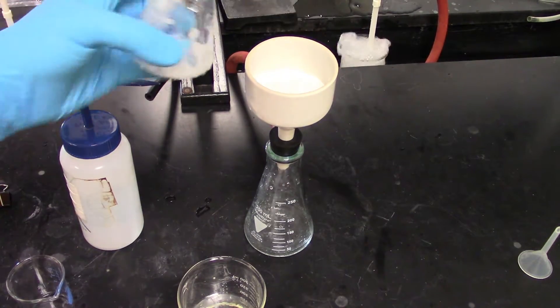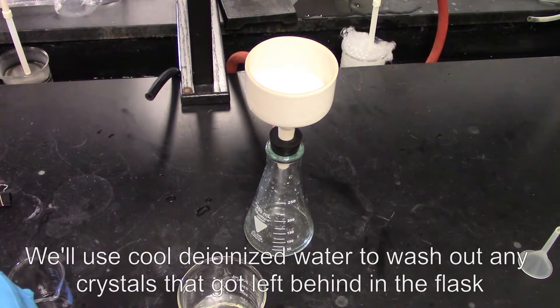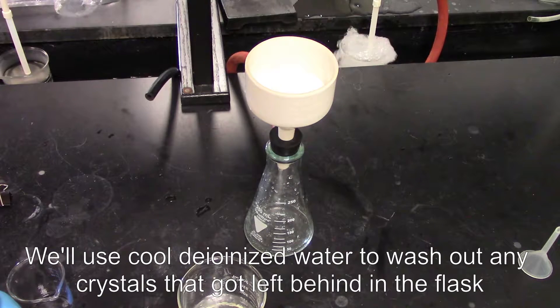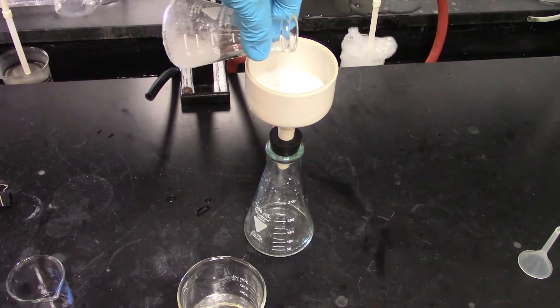Any crystals I have left over in this container I'm going to hit with cold deionized water. Honestly you can't go too much with too much DI water, it's more just kind of practical issues.